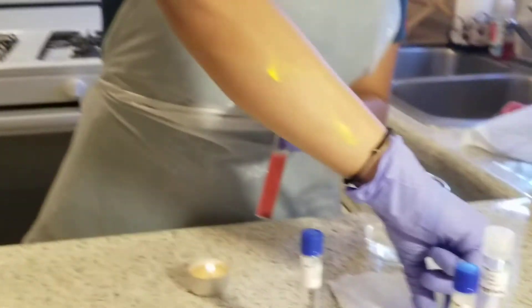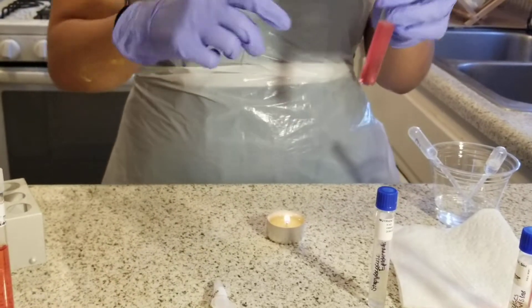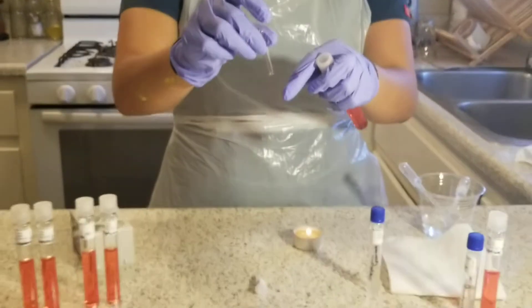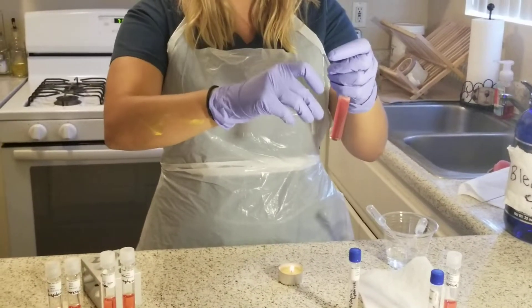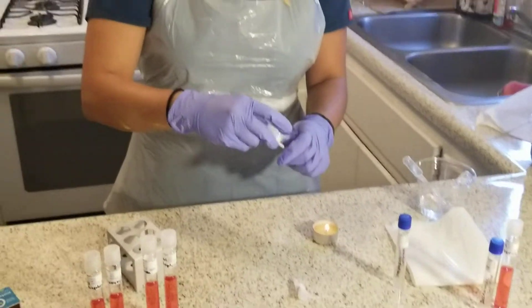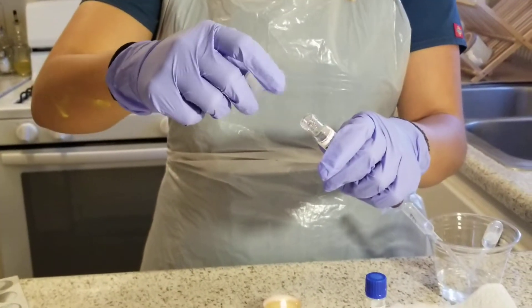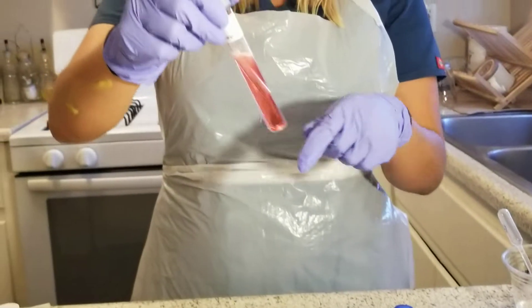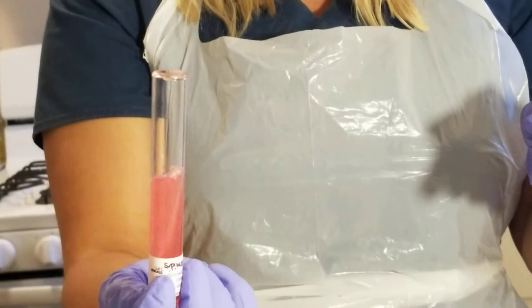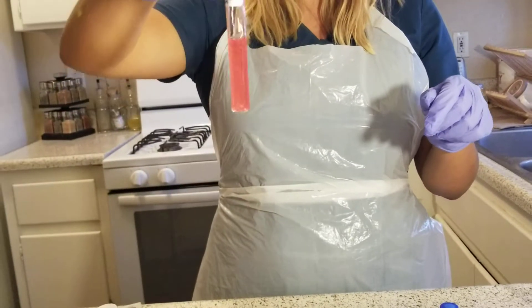I have my Durham tubes — I've soaked them in alcohol so that they're sterilized. The tube opening of the Durham tube has to be open on the bottom of the vial, so the opening of the Durham tube is going to be facing at the bottom. I'm going to open the phenol red broth, sterilize the lid, insert the Durham tube, then reflame the lid and close it. See how the Durham tube is floating? I have to make it go to the bottom, so I'm going to invert it and make sure all the air bubbles come out. Then flip it back over and it should go to the bottom.